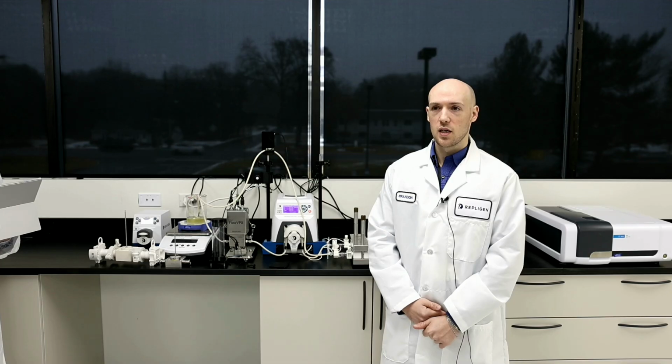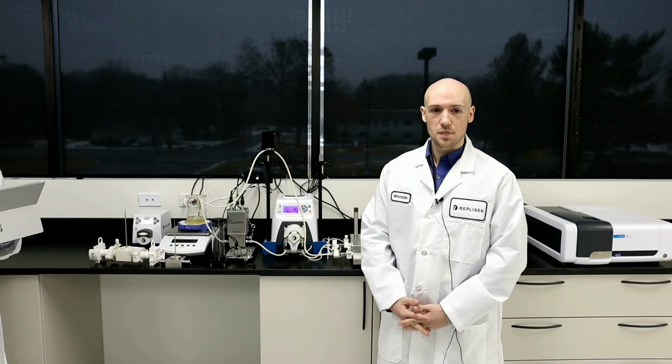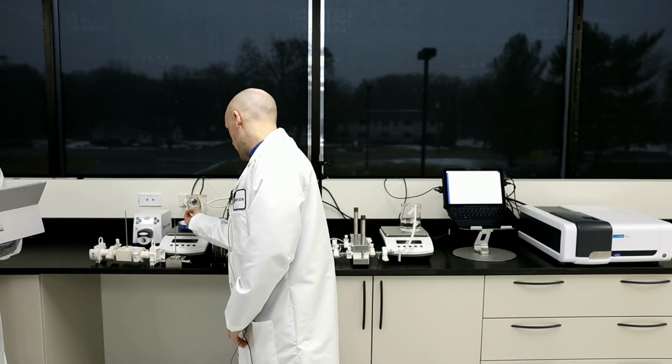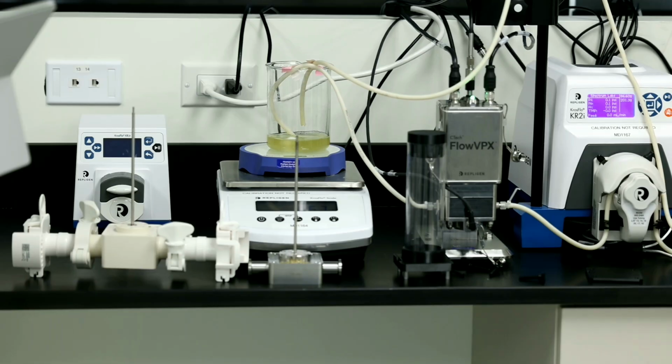Yeah. Great, thanks, Brandon. There was also a question about mixing, but I think you kind of answered that question already, so I don't know if there's anything you want to add about mixing. Yeah, well, again, mixing is something we highly advise when you're reading concentration inline, just because you want to read homogeneous samples. So basically, as you can see here, I have a magnetic stir bar inside the vessel holder because I want to make sure that everything's homogeneous when it comes to the flow VPX. If not, you can see variability when reading concentration.